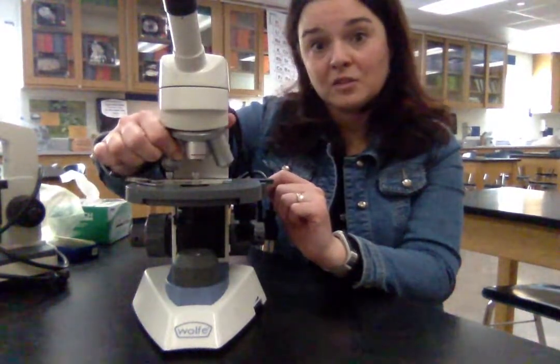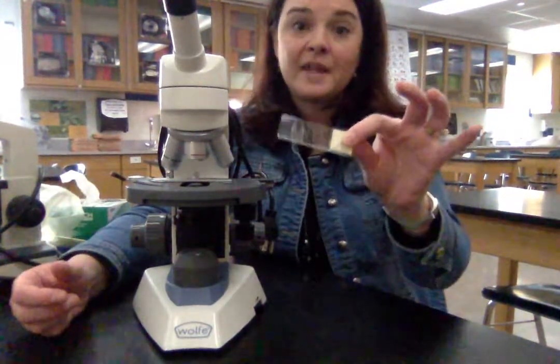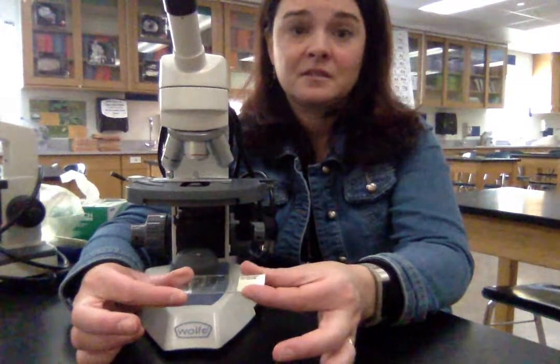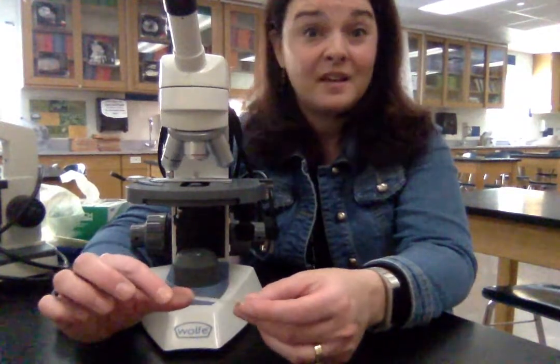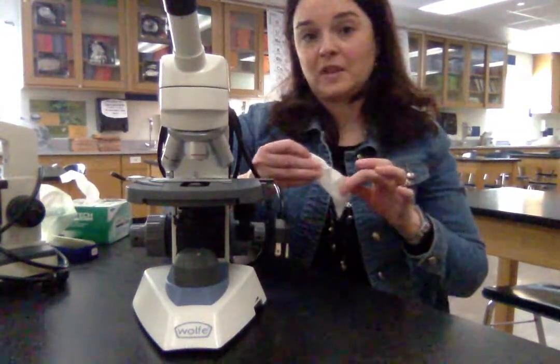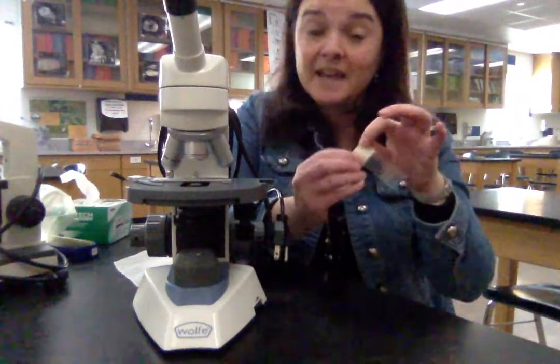Make sure you turn your nosepiece back to low power when done. Take the slide off the stage — we always hold slides by the label or on the edges. If you touch the part of the slide where the specimen is, fingerprints can leave a lot of smudges. If you think you've got something smudgy on a slide, let your teacher know and we can use the lens wipes on the slides too. Slides should always be returned where you found them — it's a big pet peeve of mine when people put a leaf slide back in the box labeled stems.